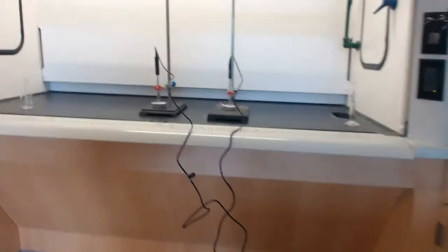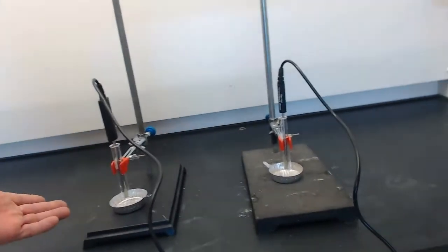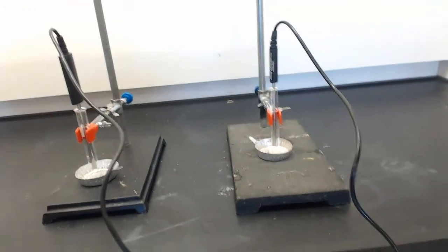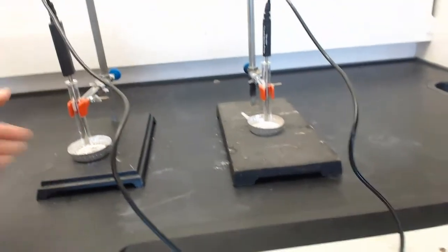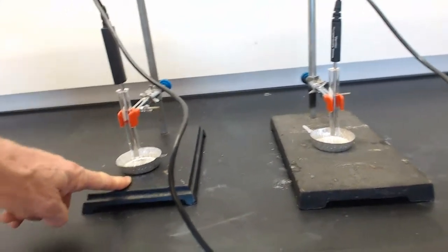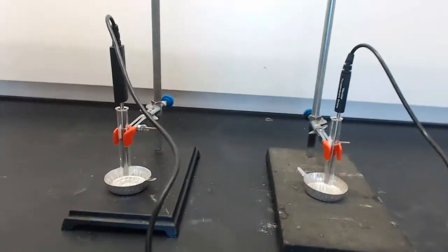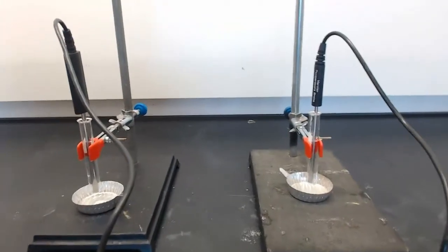Okay, let me show you what we have set up for the experiment. You should see 2 identical setups. On the left side, we're going to heat up water using methanol. On the right side, we're going to heat up water using ethanol. So methanol on this side, ethanol on this side. The setups are otherwise identical. The distance from the test tube to the weighing boat here is identical to this one. The amount of water is identical in each. The location is the same, so we should have good relative data.